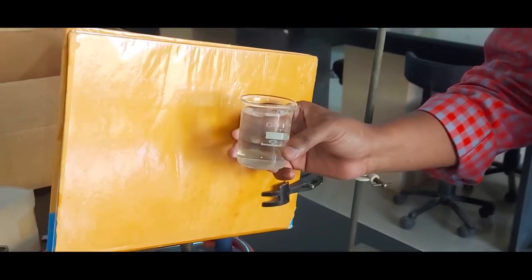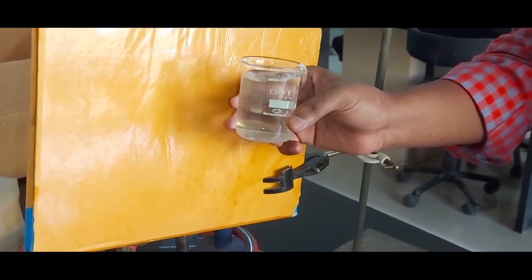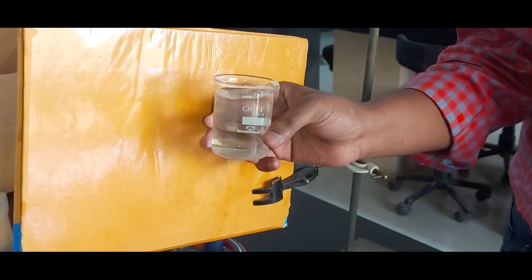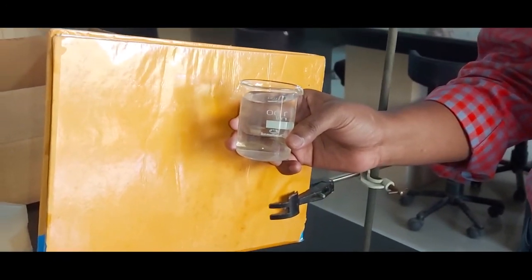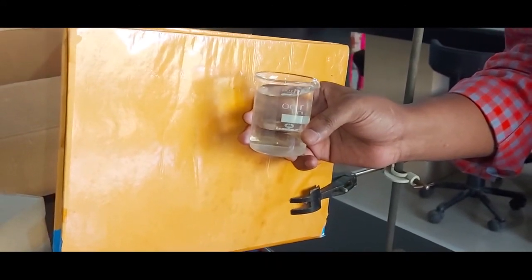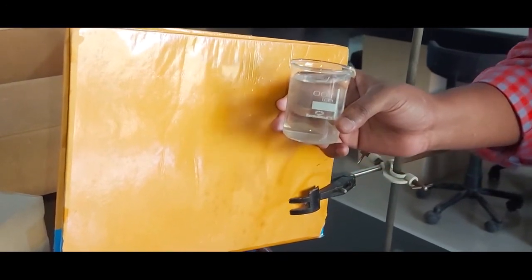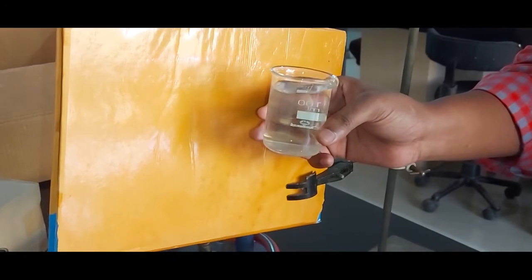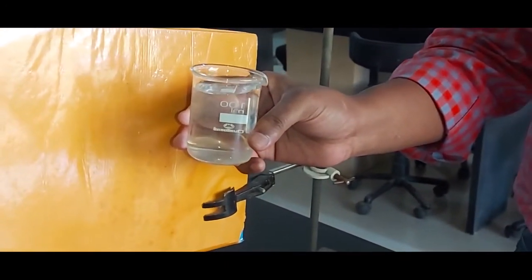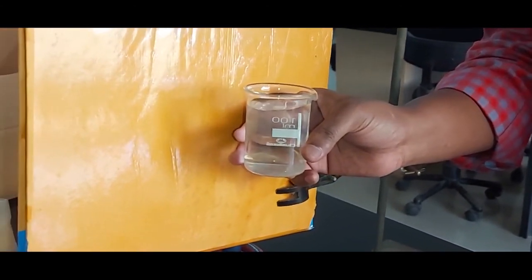The second half of our experiment is to study the clarity of the water samples. Measuring the clarity of water samples is an important part of environmental science. Often lakes and streams contain pollutants or sediments that make the water cloudy, which has a bad effect on organisms that live in the water. Typical sources of turbidity in drinking water include waste discharges, algae or aquatic weeds, humic acids and other organic compounds from decay of plants and leaves.